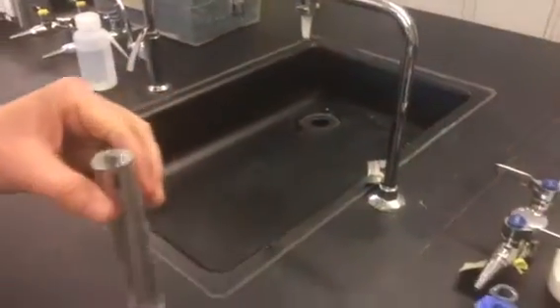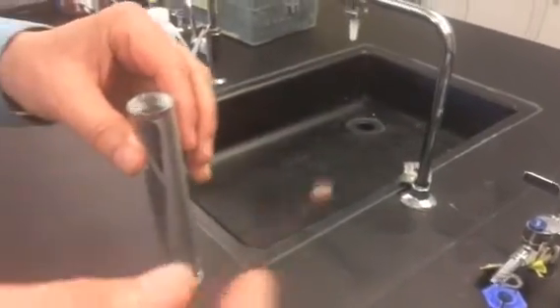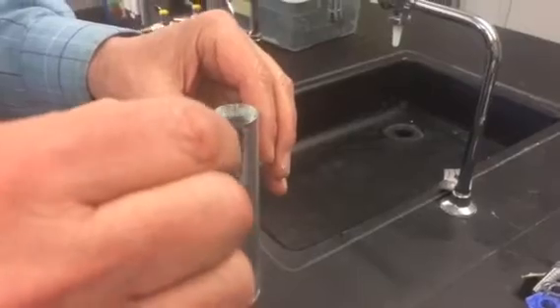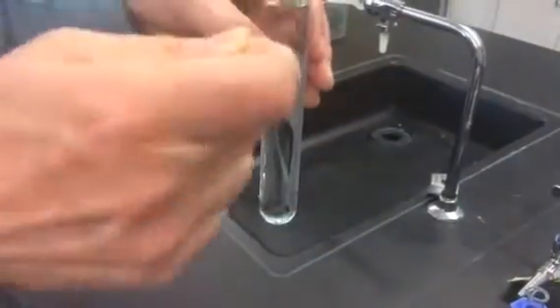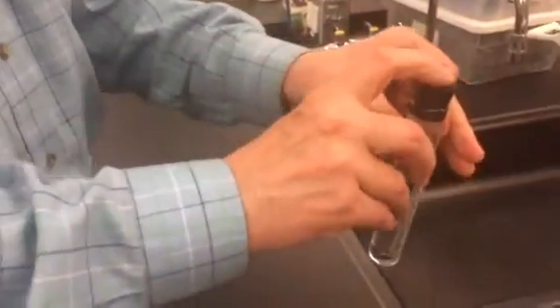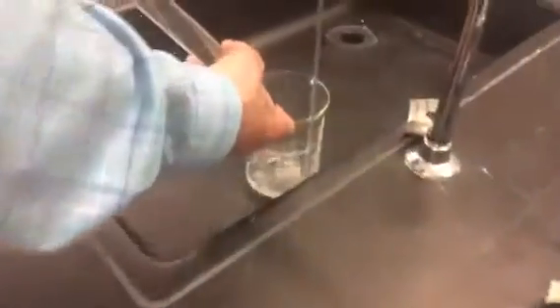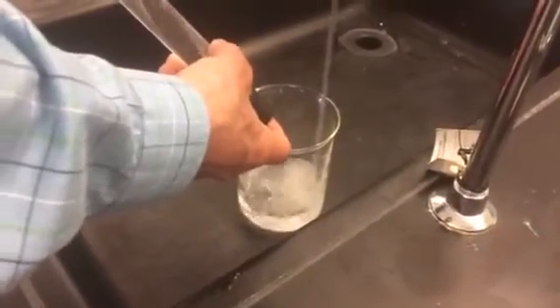and then you're going to take your caged piece of magnesium and put it in the test tube and stick it down, which is of course going to be up when you flip it over, maybe a couple centimeters or something. You want to keep it near the bottom where the acid is going to be most concentrated. So as you then have that in there, you're going to go ahead and put the stopper in the test tube, put your finger over the hole and invert it in a beaker that has been half filled with water previously.